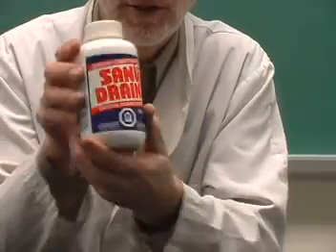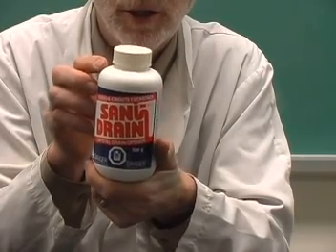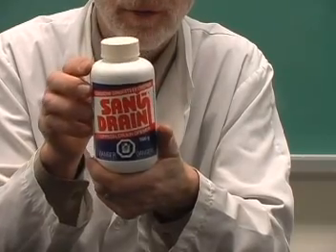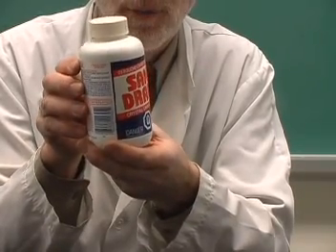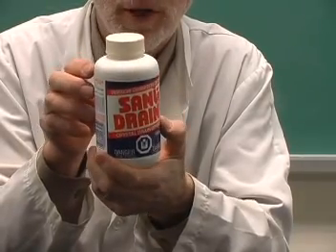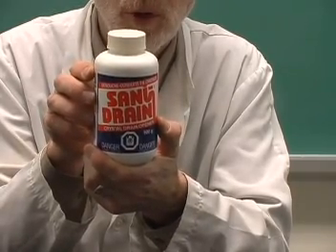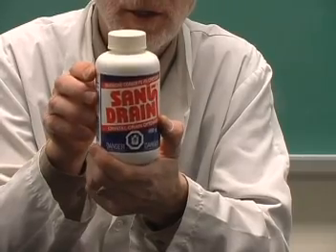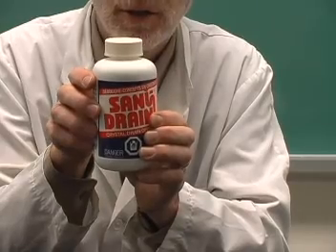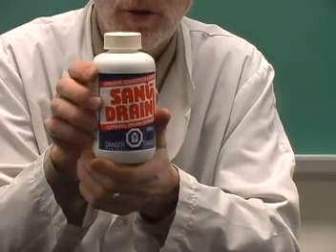Another base is drain cleaner. Drain cleaner contains sodium hydroxide as the principal ingredient, along with small amounts of aluminum metal often. In many cases, you can separate the pellets of sodium hydroxide from the aluminum metal to make a relatively pure solution of sodium hydroxide. To make a 1 molar solution of sodium hydroxide, you need approximately 4 grams of sodium hydroxide pellets dissolved in 100 milliliters of water. And that gives you a 1 molar solution.